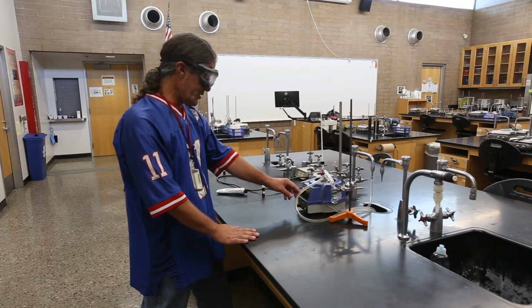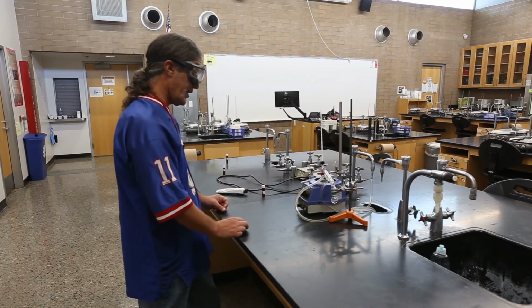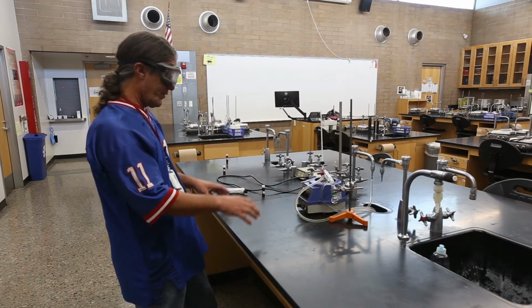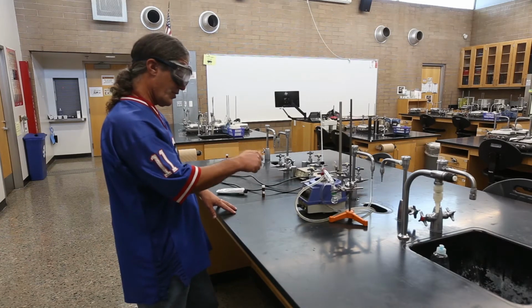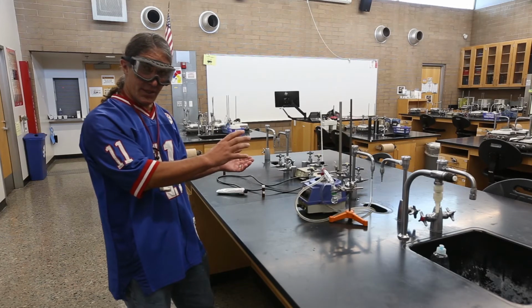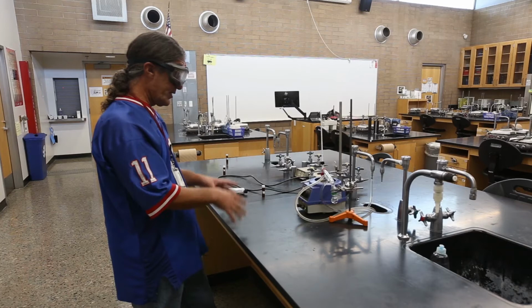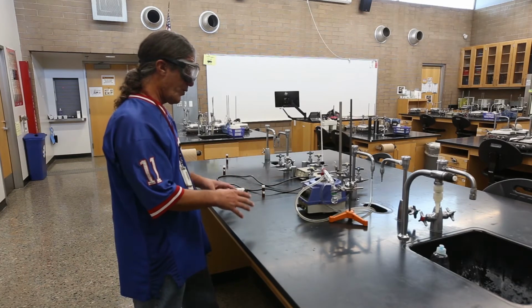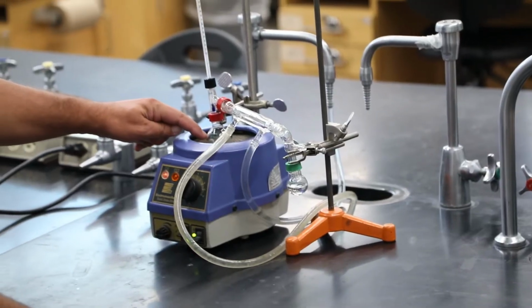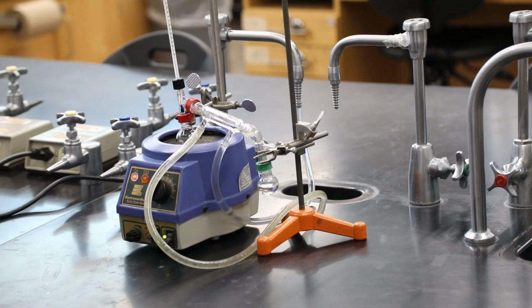Now that the heating mantle electricity is off, this should cool down fairly quickly, but there's enough residual heat in the heating mantle that it might boil for a while. That's like on your stove. I always think of the chemistry as being cooking. If I turn the stove off, the stove is still going to be hot for a while, so I'm not going to want to touch it. I'm not going to expect things to instantly stop cooking. I have to wait till they cool off a little. So that's why before I got totally low in the liquid here, I shut the heat off and raised it out so it can wind down and stop.